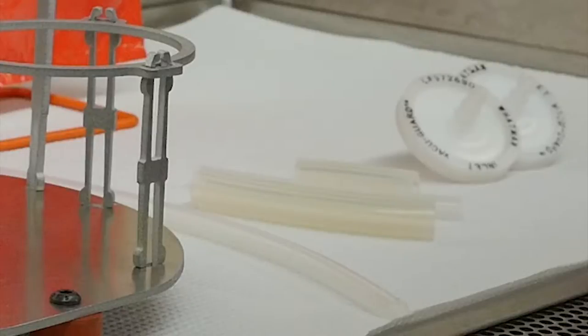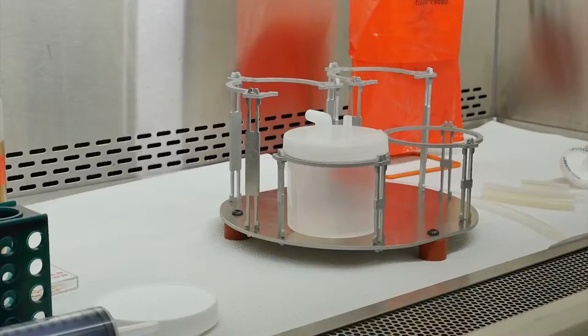Add tubing for the elution device and VacuGuard filters to contain bioaerosols. A sterile collection cup with a modified lid fits inside the front circular support on the elution device stand. The elbow port should face toward the filter stand. The collection cup will hold your eluent after elution.